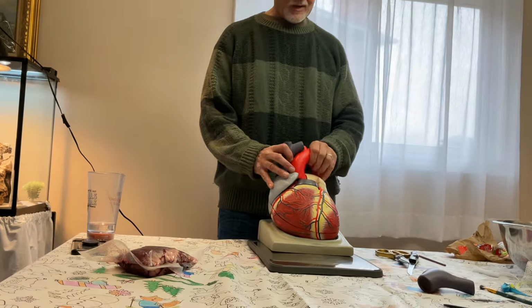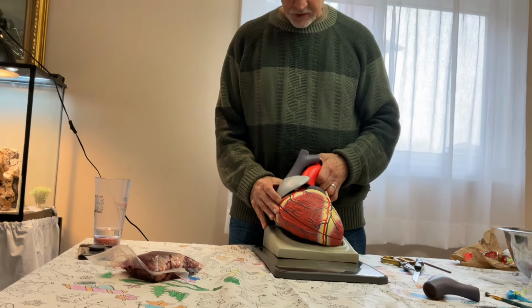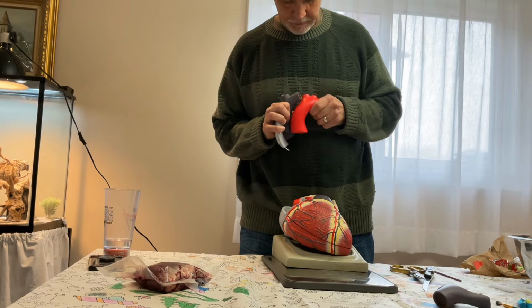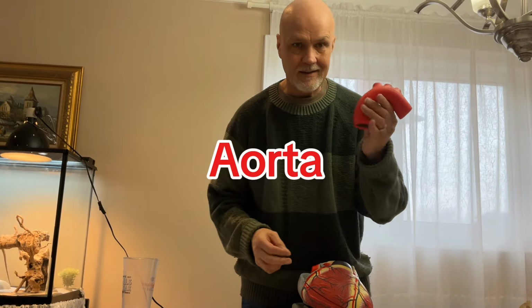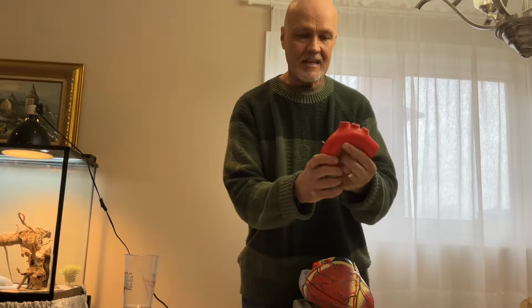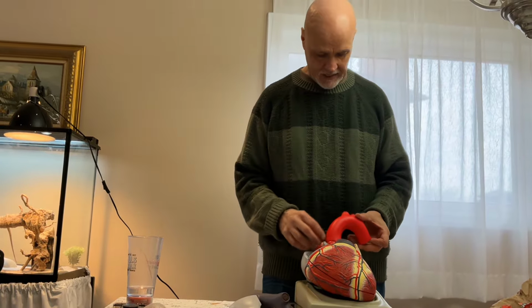Now let's look at this one here. This one here is gigantic, okay? And I'm going to pull this whole section off here because that's sort of how it comes apart. This one here is the aorta. And it's gigantic. Actually, a whale's aorta is big enough you could stick your head in there. This is an aorta, and it carries oxygenated blood away from the heart to the rest of the body.